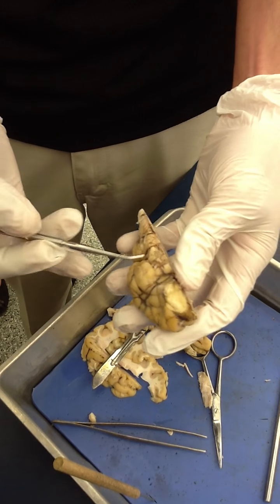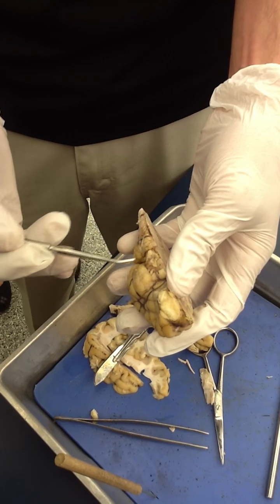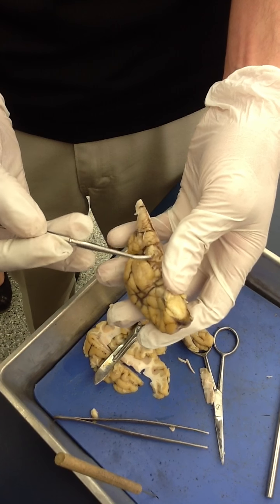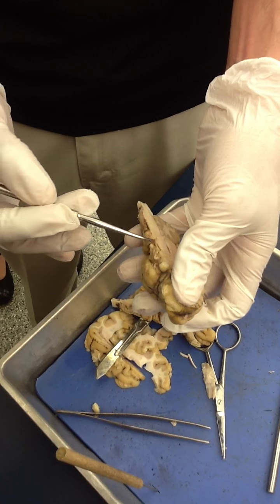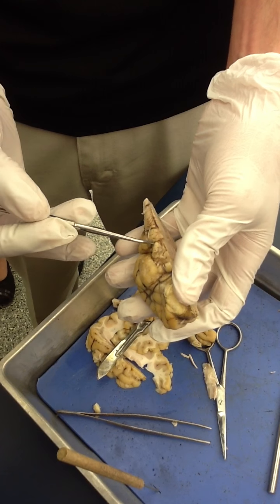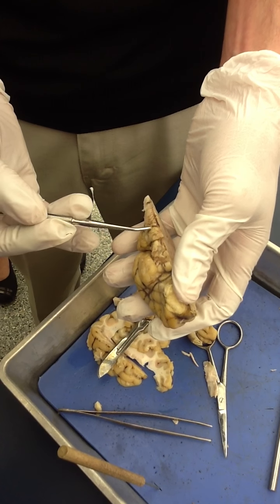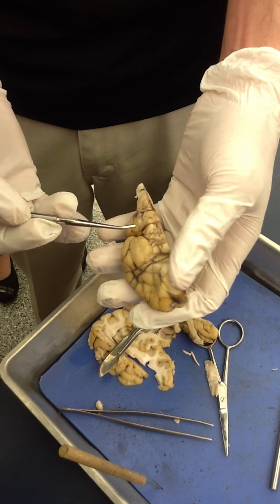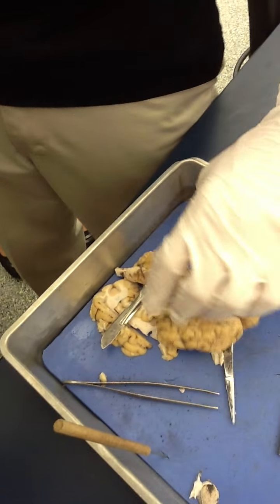Remaining structures on the anterior brainstem: cranial nerve number three, the oculomotor. These are the cerebral peduncles between the thalamus and the pons. Look below the pons — here you see cranial nerve number six, the abducens. Number five has been torn off this side; I do believe I have it on the other half.